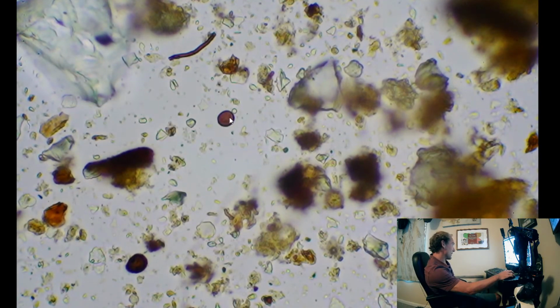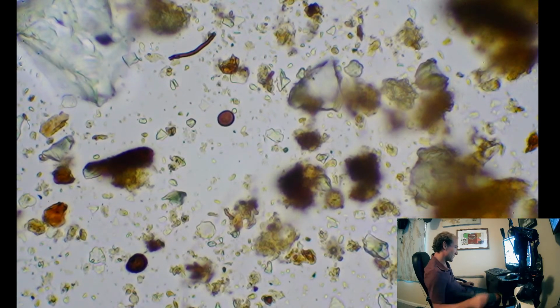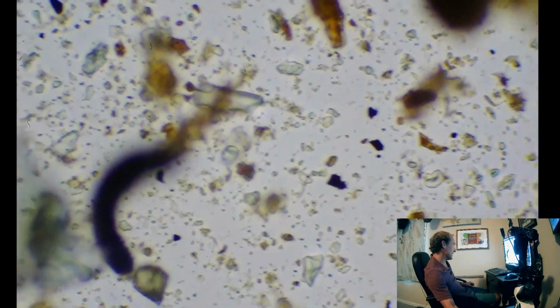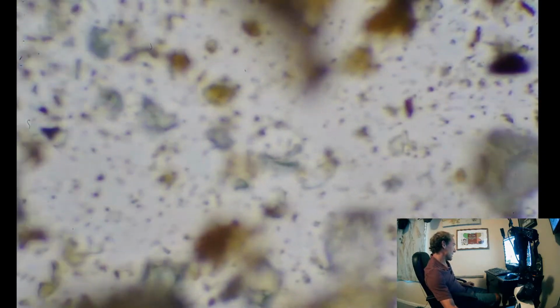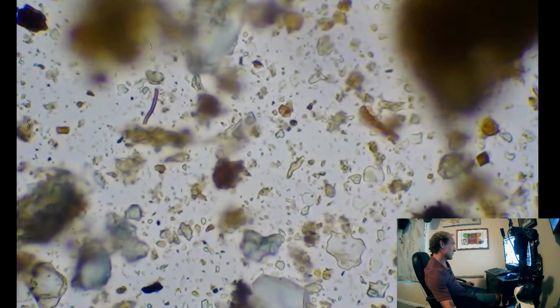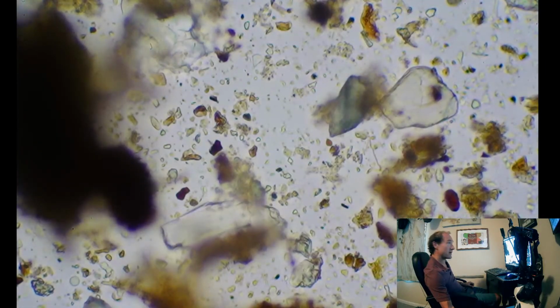And, oh yeah, I wanted to mention the fungal spore that we see right here. Another piece of little fungal hyphae. But yeah, a whole lot of bacteria. I'm surprised we haven't seen any funky strands yet. I was expecting to see actinomycetes, oomycetes, actinobacteria, because those are the things that really lead to all sorts of fungal pathogens. Well, mainly in my experience, powdery mildew.